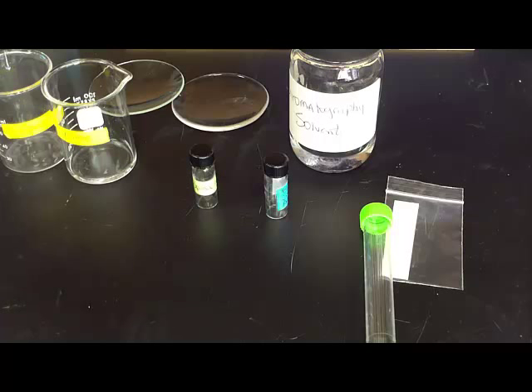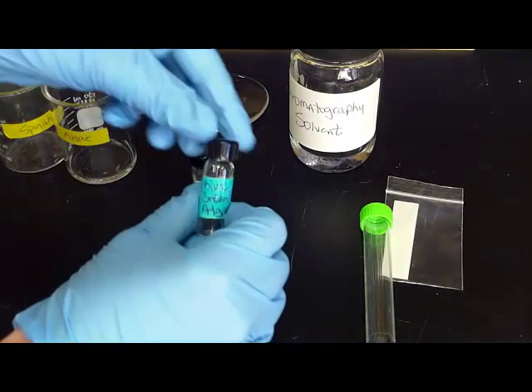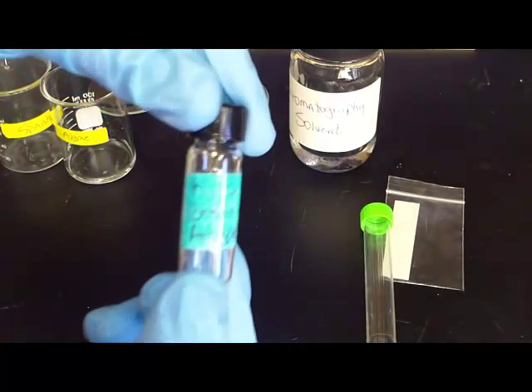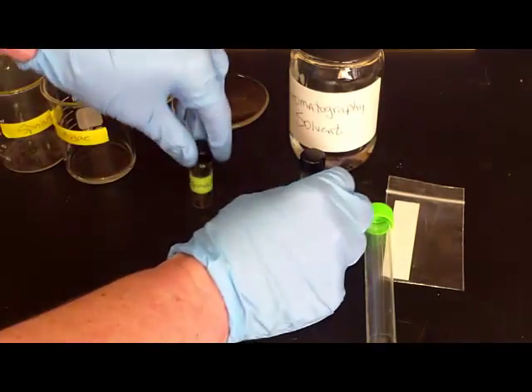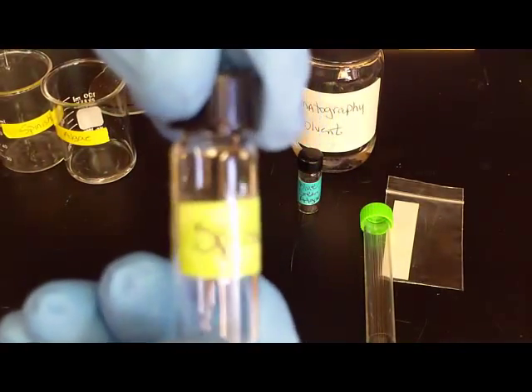For our chromatography lab let me go over the materials and then I will go over the steps on how to do each. So you will have two different colors of vials: blue-green algae, maybe kind of hard to see, and then you'll have another one of spinach extract.